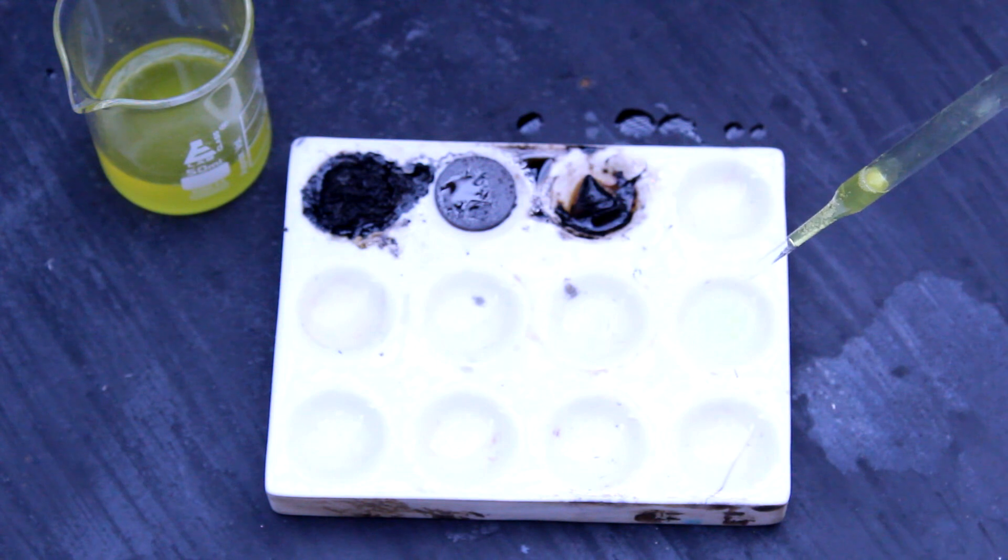I even tried adding the acid to methanol, but there was no visible reaction. Overall, the dilute chloric acid doesn't actually seem that bad.